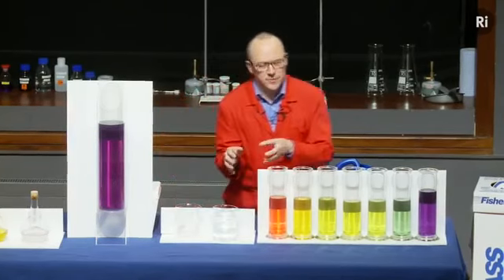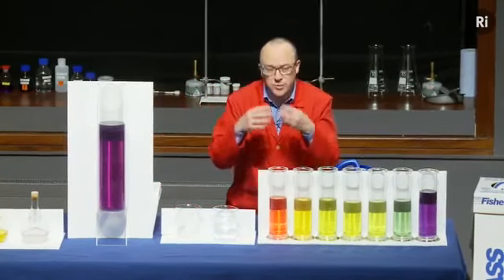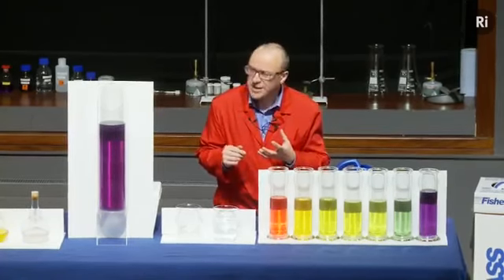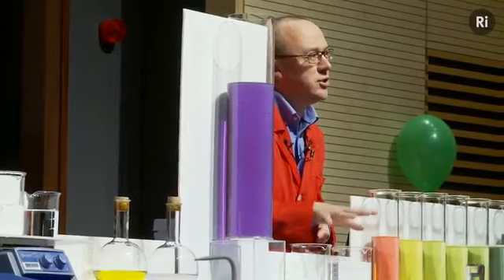It seems as if a chemical reaction began and produced a colour change, and then it sort of changed its mind and went backwards. So did it go backwards? Did that chemical reaction go backwards?